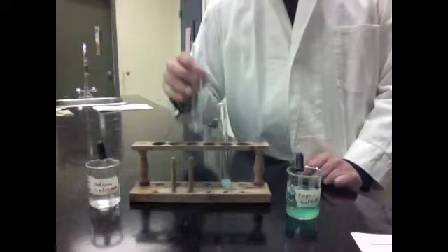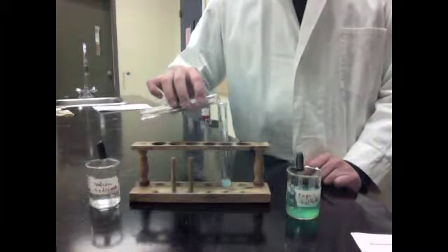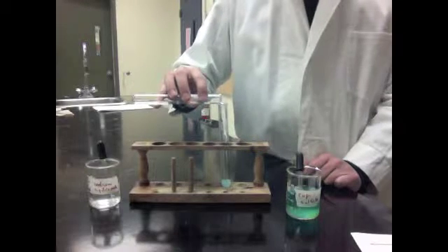Next, you have to pour one test tube into the other. Watch out as these two chemicals are very corrosive.